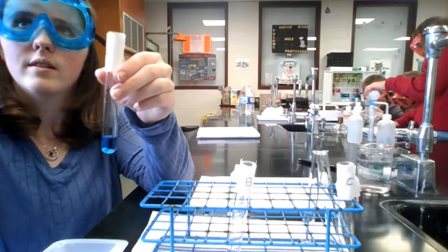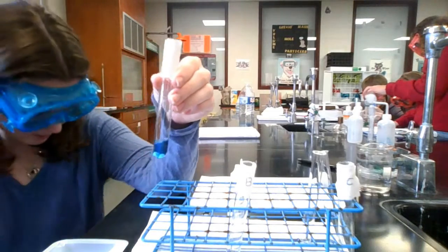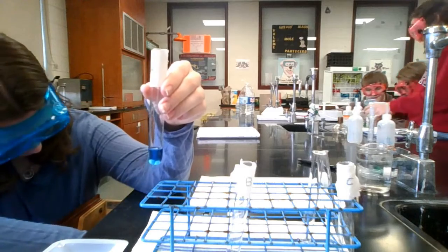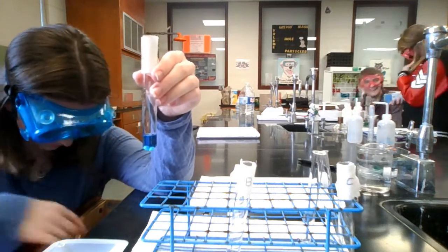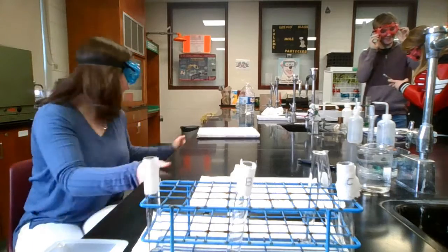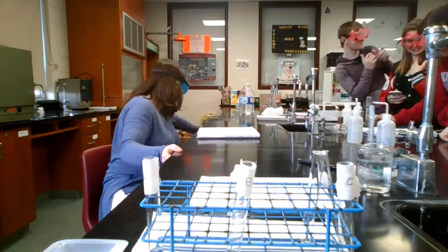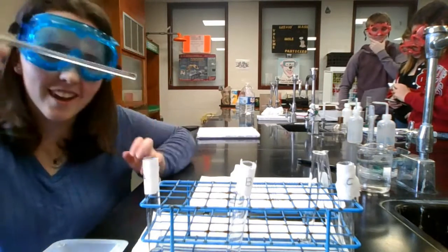What? No, let's just start. Okay. Can I go get a stirring rod? Aha!